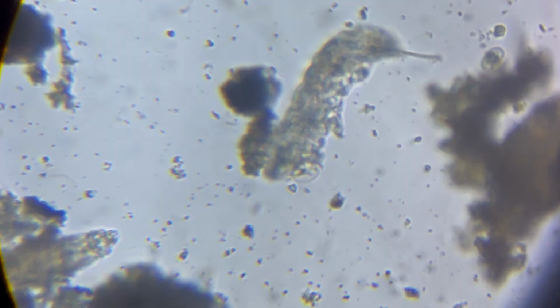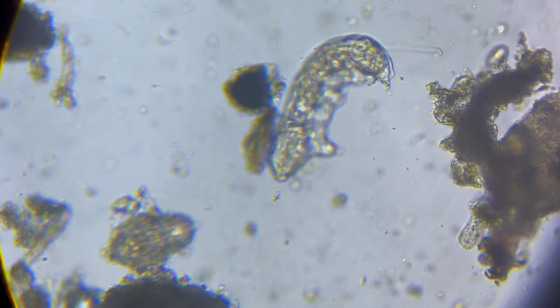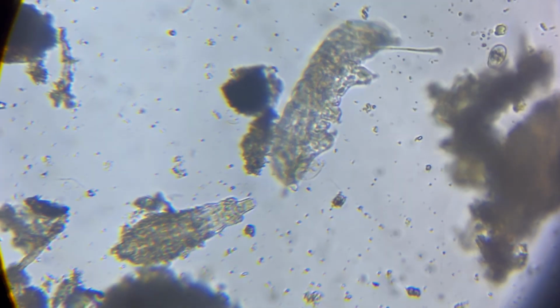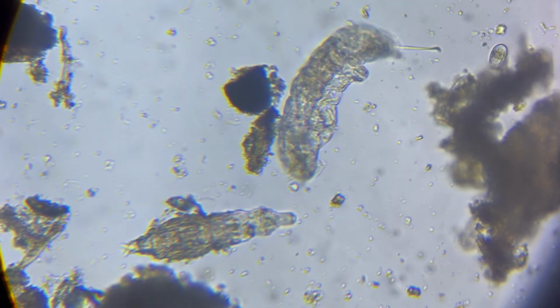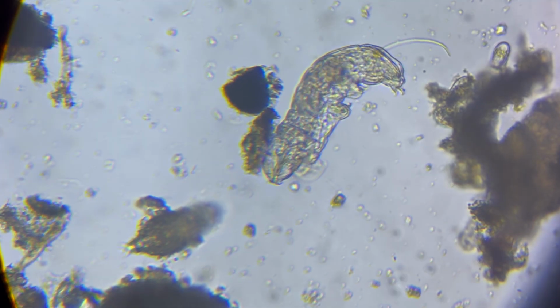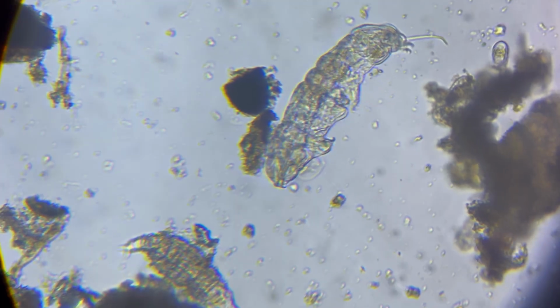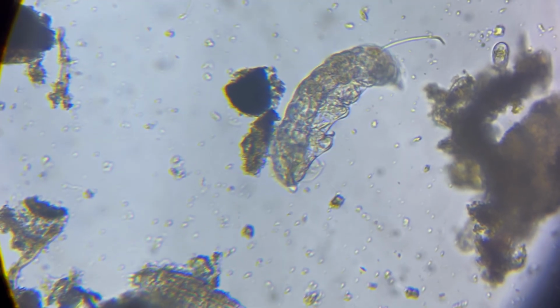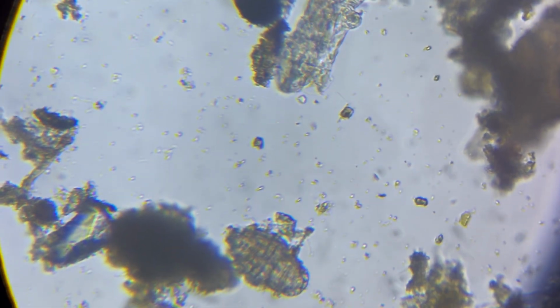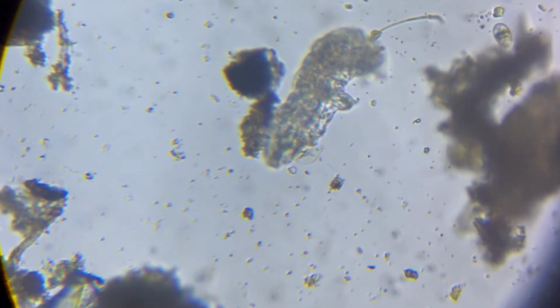Now, what was incredible was the little fly larva started to approach the tardigrade. It came over, sort of had a little sniff, and boop, maybe a little kiss, I don't know, and off it went. I genuinely had no idea what was going to happen to that poor little tardigrade. It looked quite helpless, sort of flailing around there, but the fly larva didn't seem that interested.